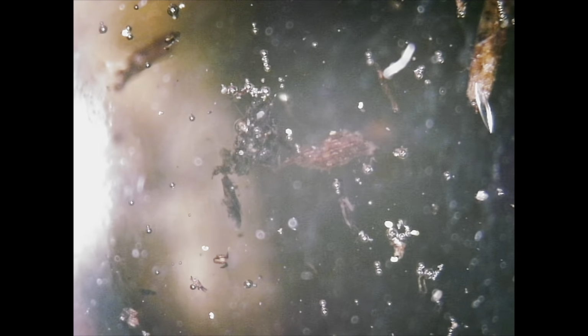As mentioned previously, the sample came from Mono Lake, a body of water with such a high pH that pretty much zero fish were able to survive. However, there were apparently some really resistant bacteria that managed to thrive in the environment. I predicted that there would be no visible microorganisms, so it was finally time to check out if I was right or not.